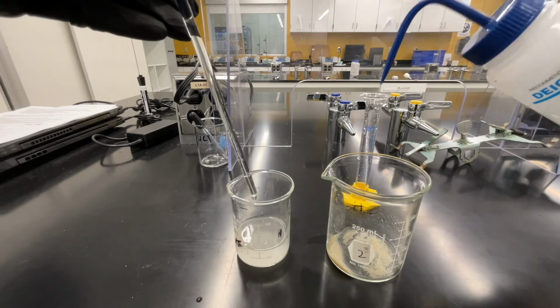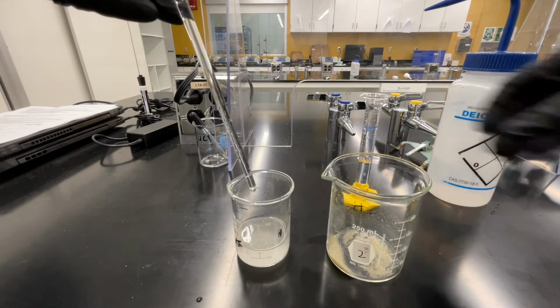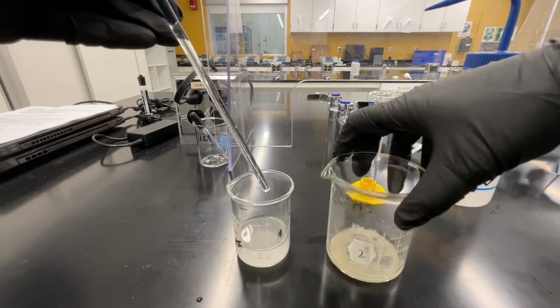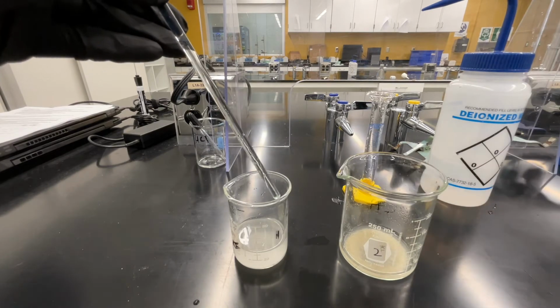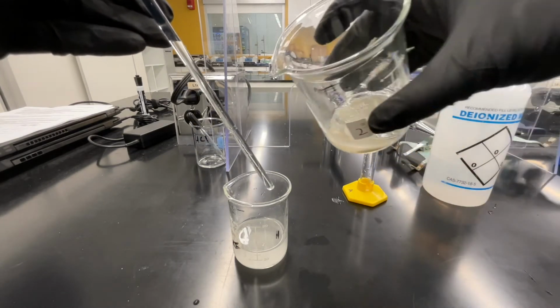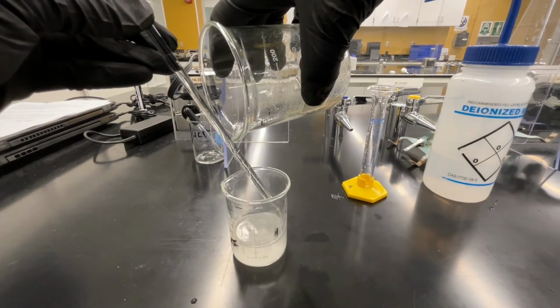The washing process helps to give us a more complete separation of the components of our mixture. Again, here you want to think about what substance is it that's being left behind as a solid, and what is it that we are decanting into beaker number 1. It helps us to be able to understand what it is that's happening at each step and how it is that each step in the procedure is helping us to separate the components of our mixture.